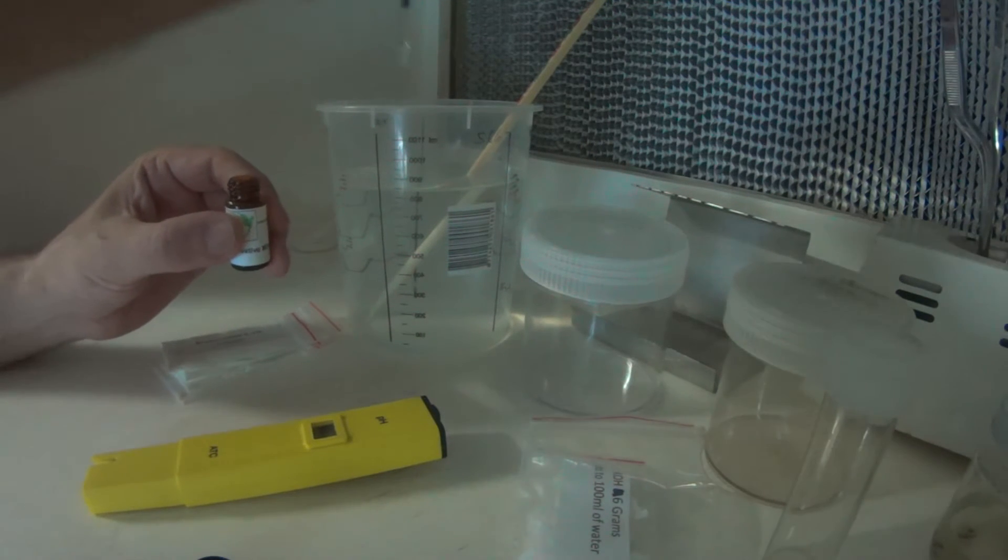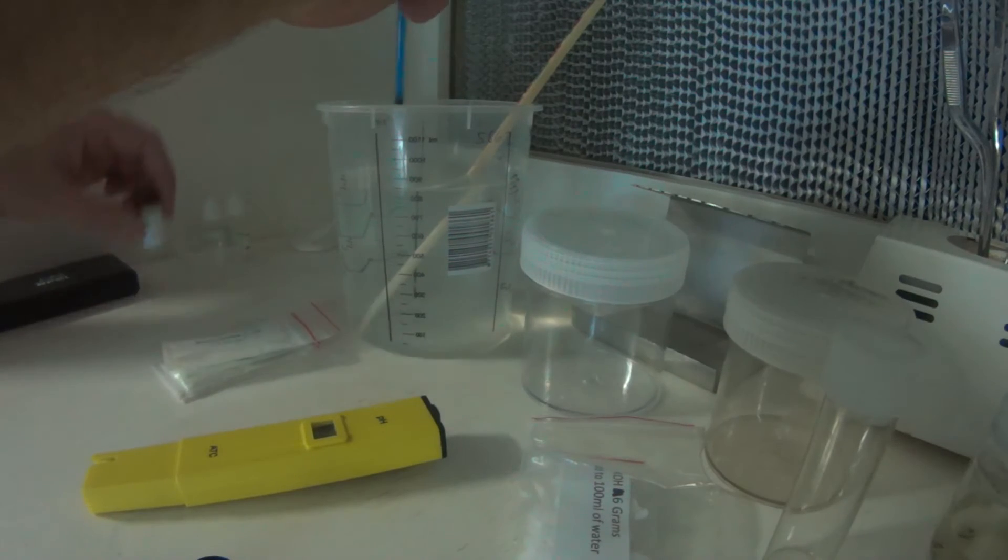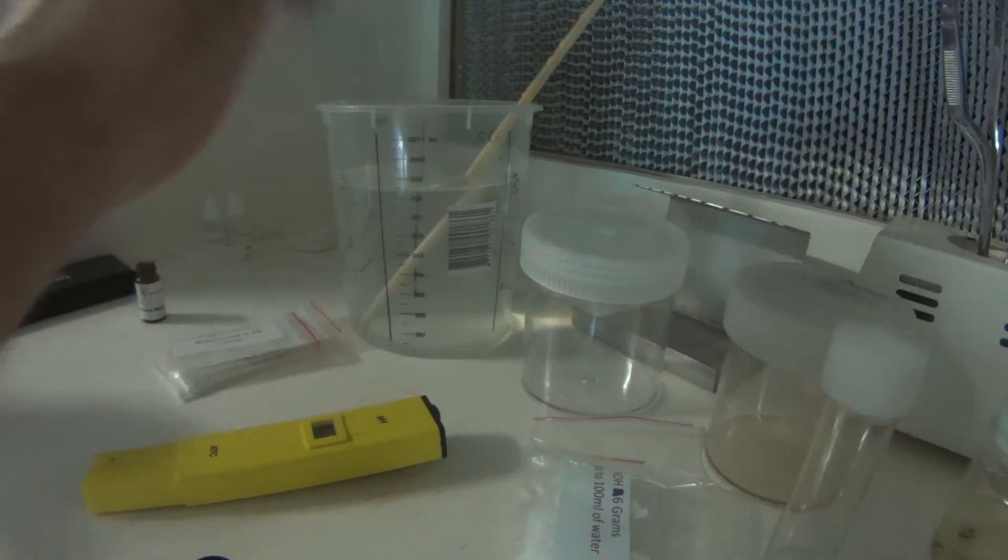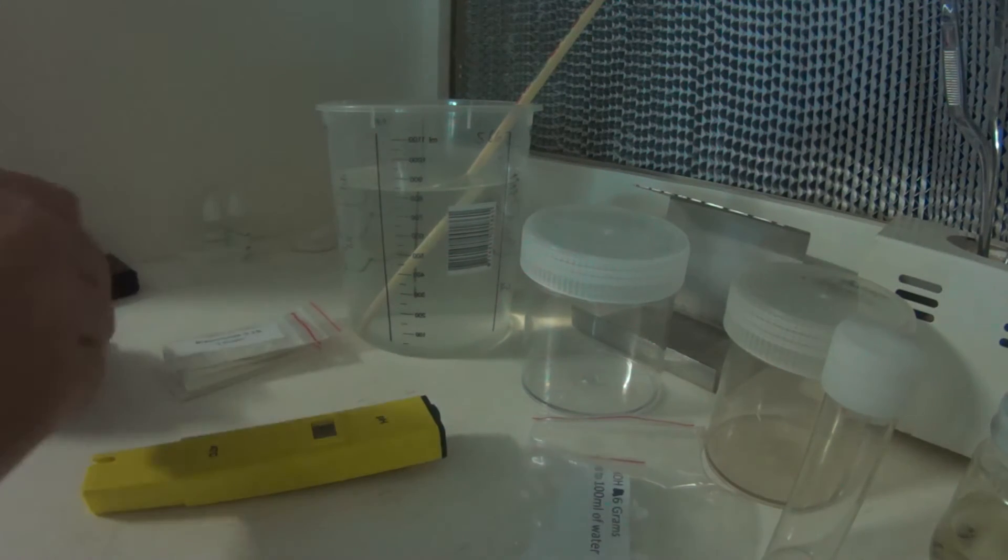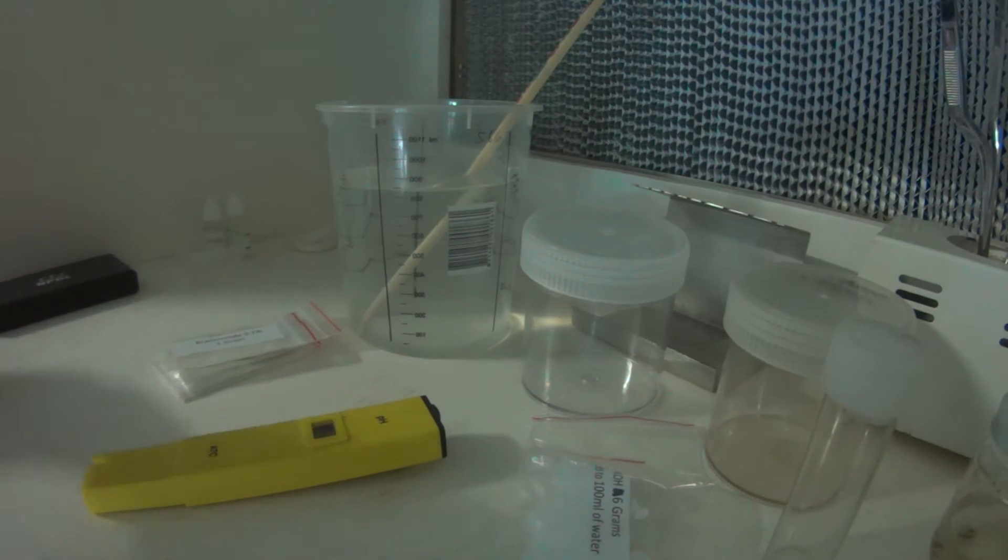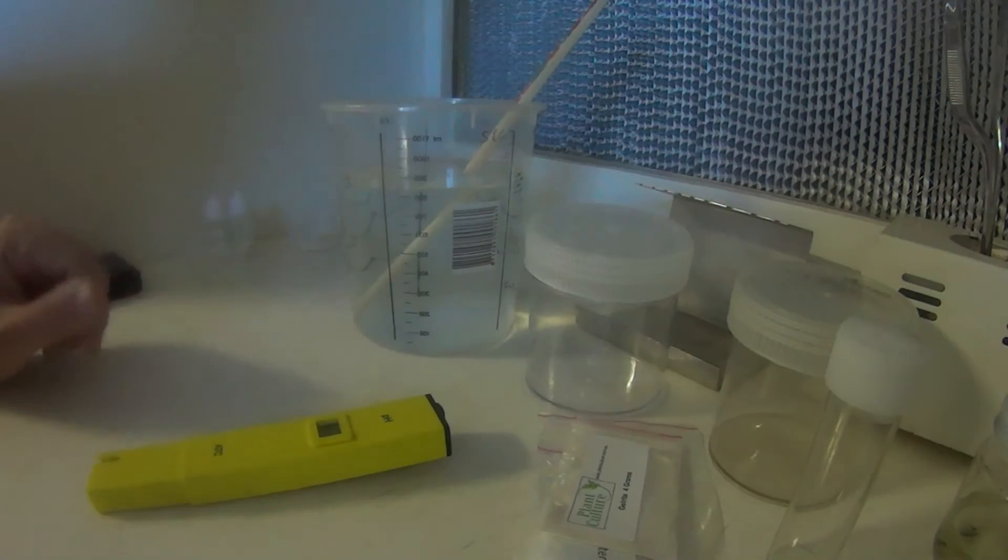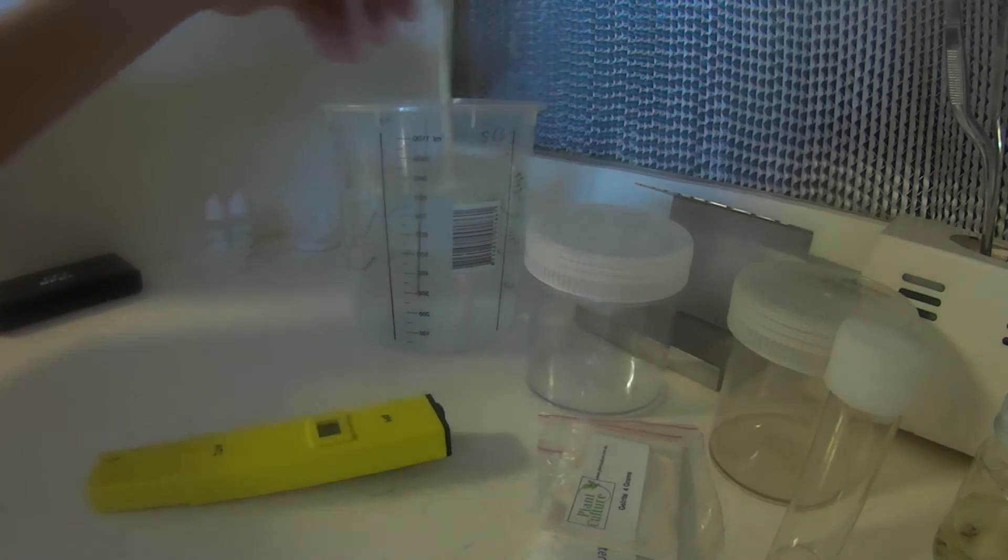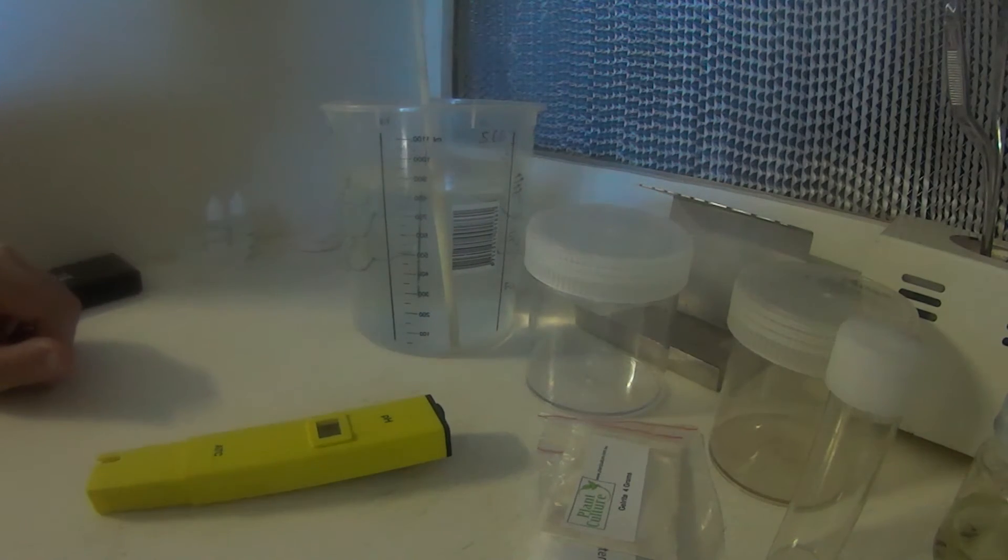Like I said, basically, the kit contains everything you need, apart from a pressure cooker and the various plastic tubs and bowls. We've added our PPM in there and give it a bit of a stir, so we've got our MS salts, PPM and sugar in there.